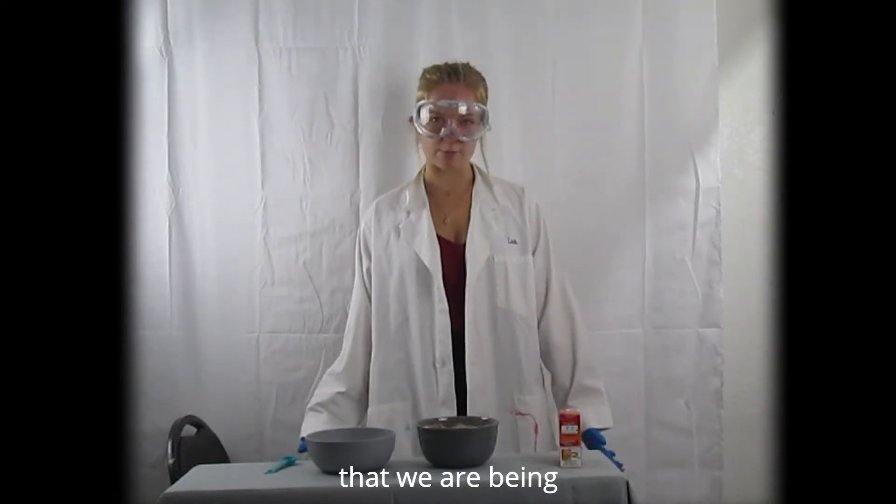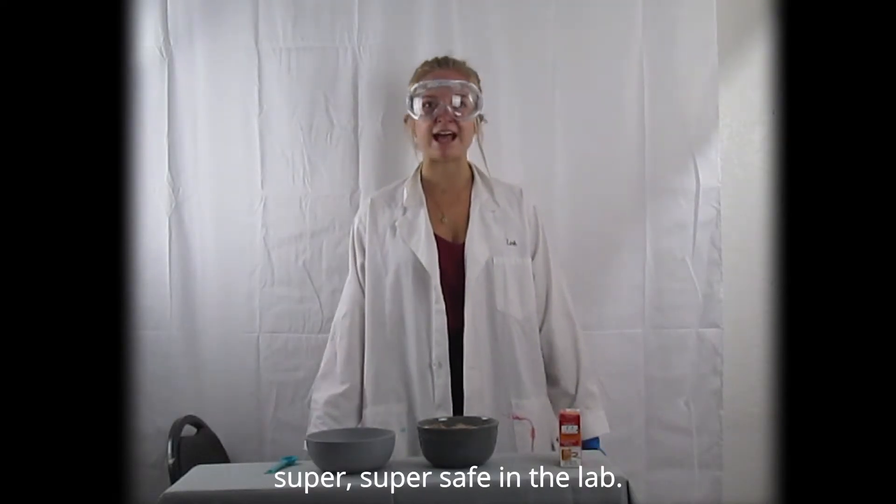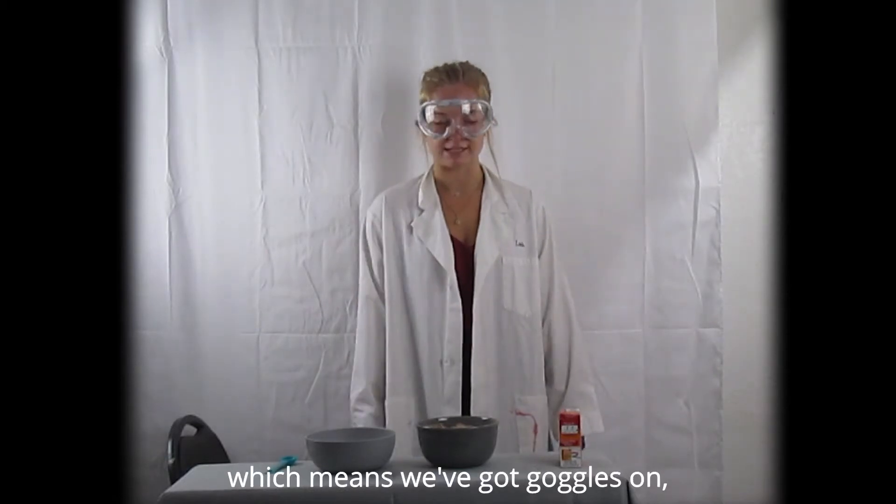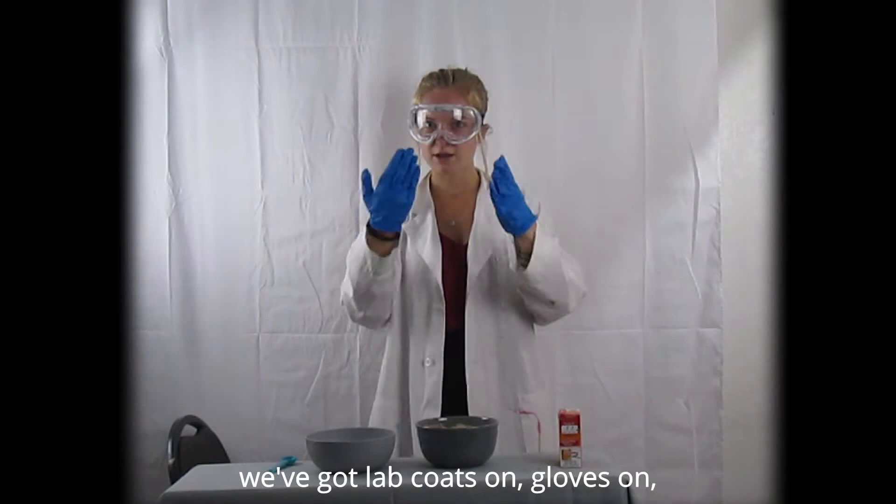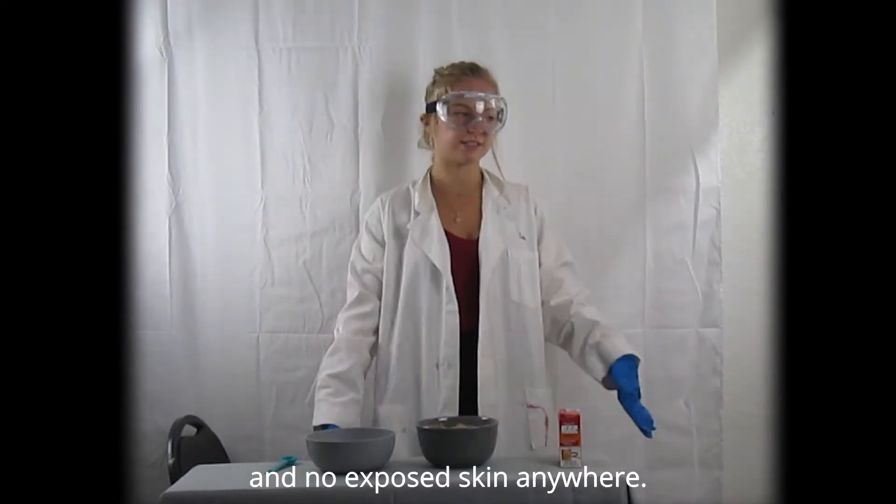As always, let's make sure that we are being super safe in the lab. We're covered from head to toe, which means we've got goggles on, we've got our hair back, we've got lab coats on, gloves on, and no exposed skin anywhere.